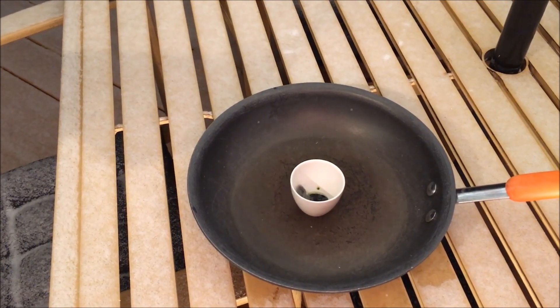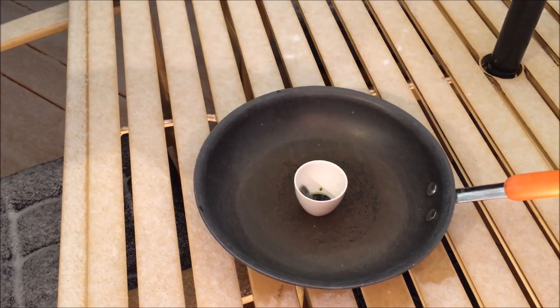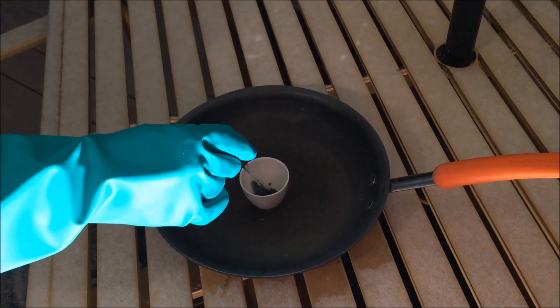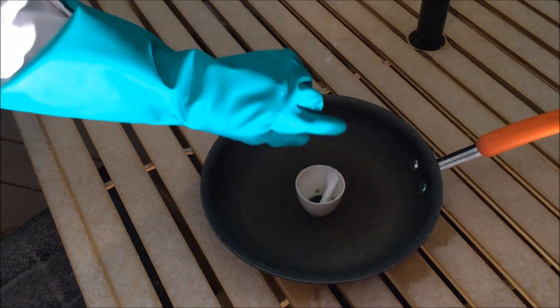But when you are doing reactions with manganese heptoxide, always be careful and wear heavy gloves and a jacket. If you don't take necessary safety precautions, you could get concentrated acids on you or strong oxidizers.